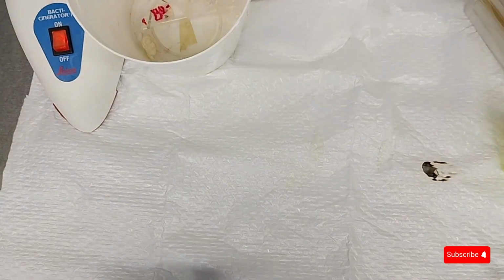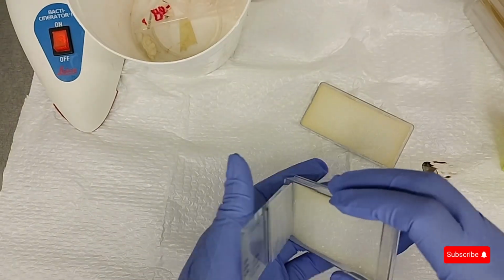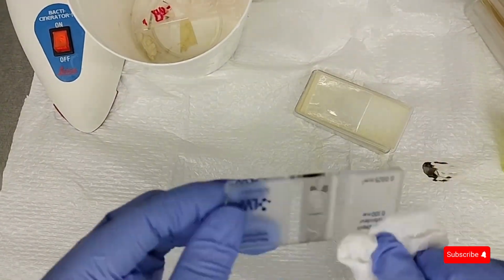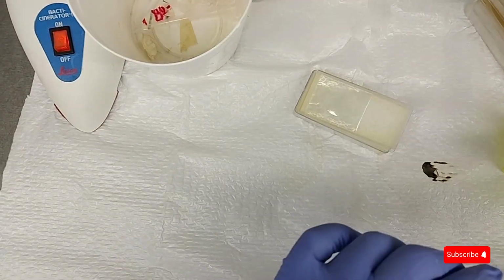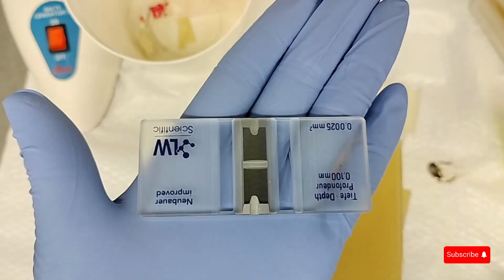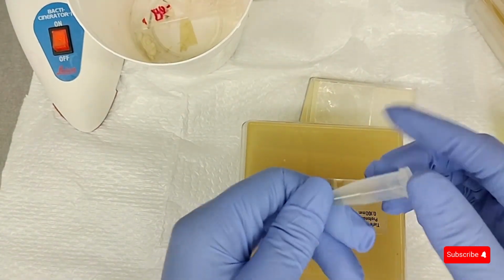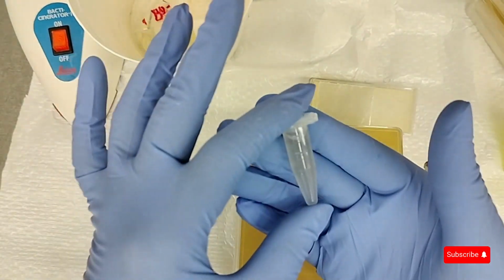Before I go ahead and put the spores of the fungus onto the agar plate, I like to do a quality control. I like to check to ensure that the sample I'm taking is free of contamination, so only my fungus of interest is in the water that contains the spores, and the shape is what it should be. I'm cleaning the hemocytometer, the counting chamber I use to count, to ensure that I have a high enough standard amount, maybe like 1,000,000 spores. The counting chamber was originally created for counting blood cells, so it's called a hemocytometer.